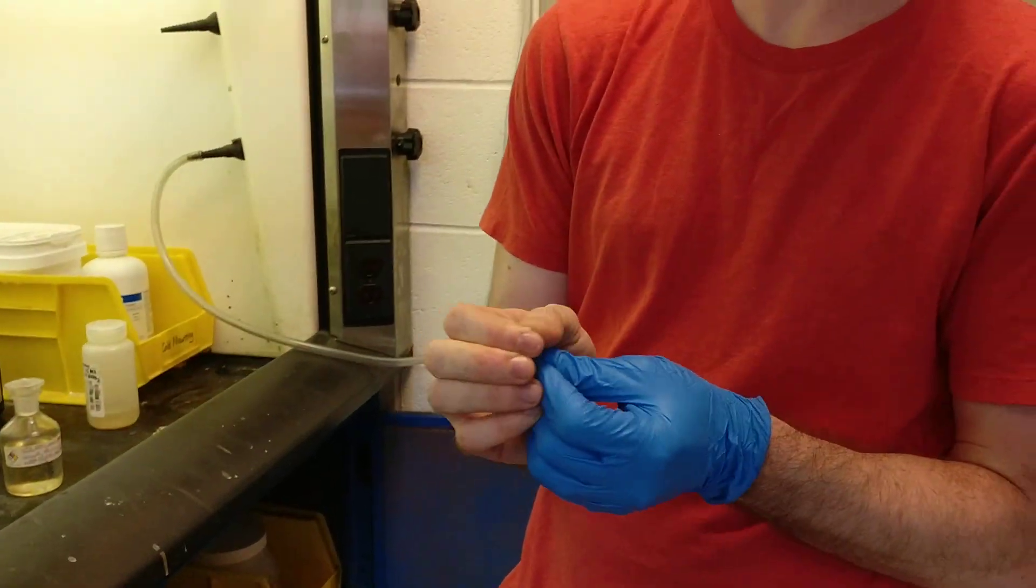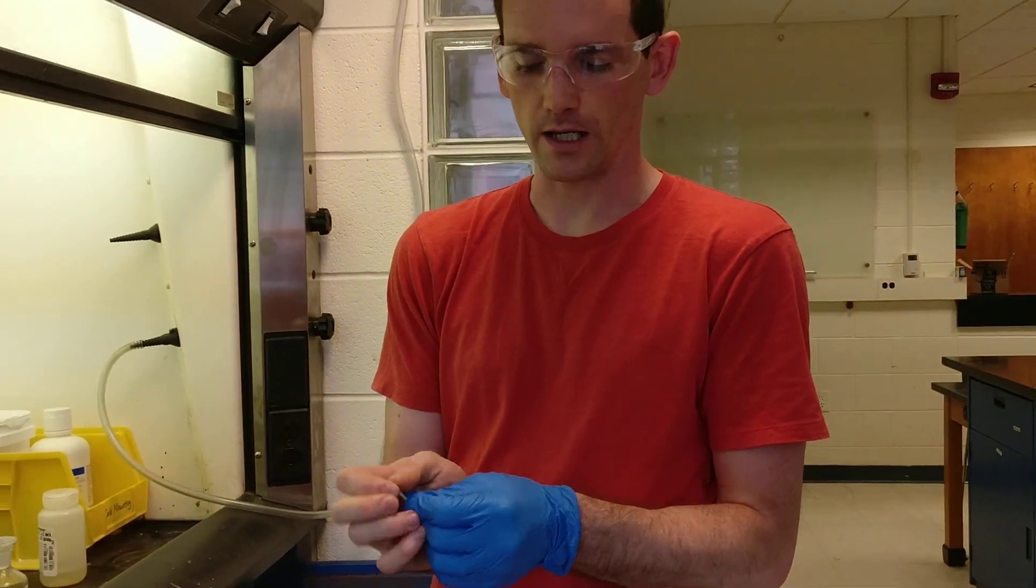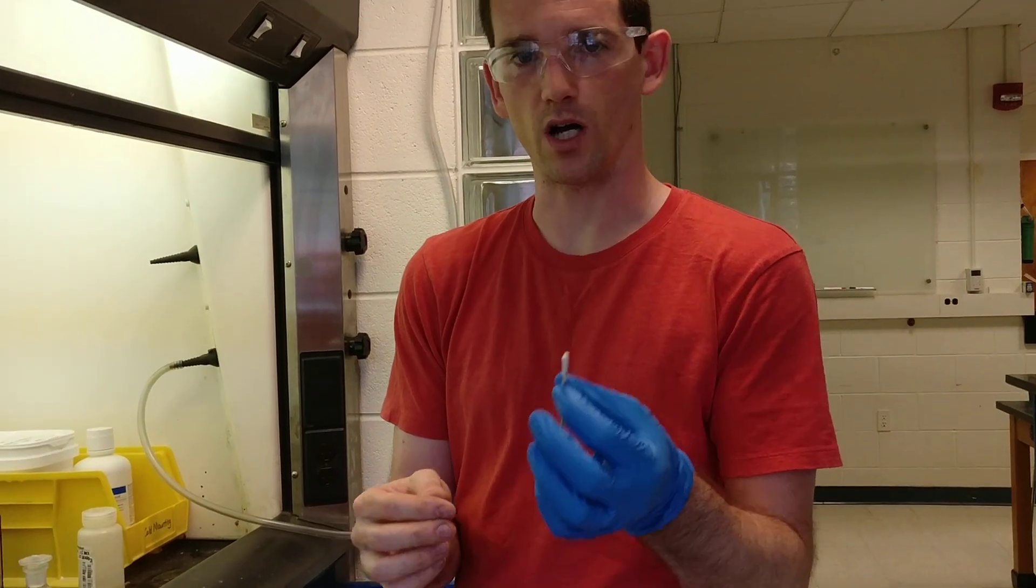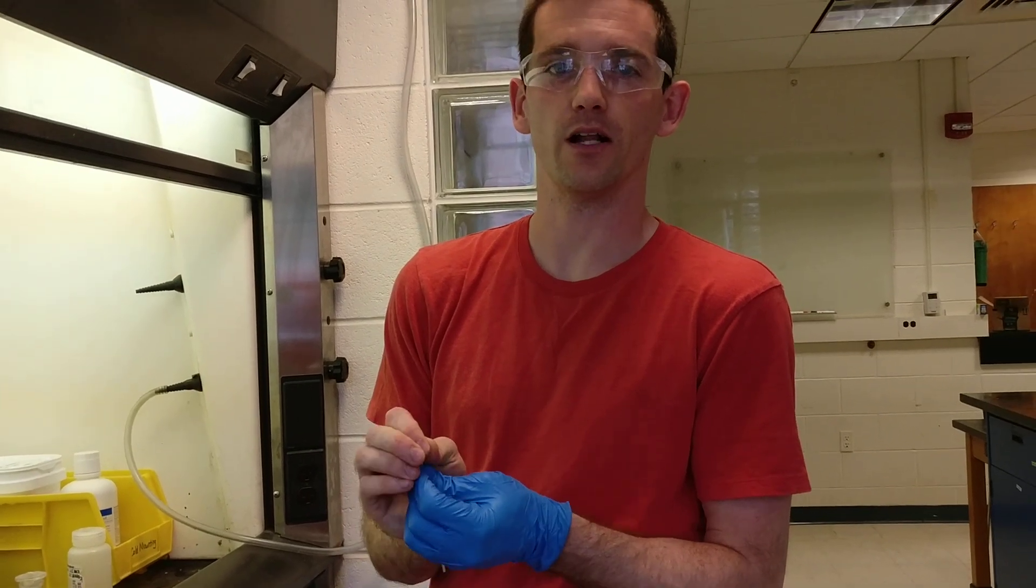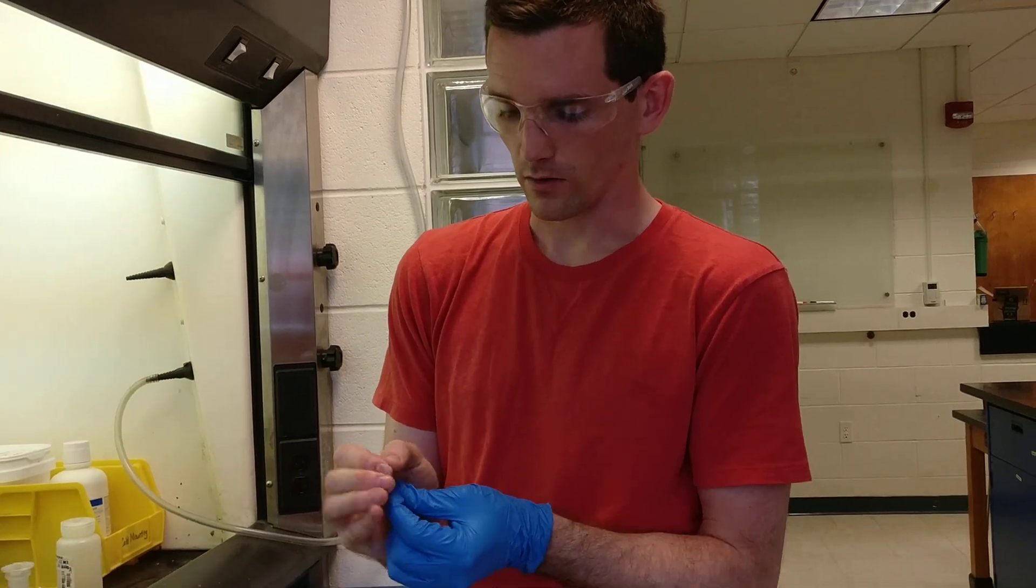One of the most important things when we etch is that we get a lot of the etch into the swab. We should swab etch on steel, aluminum alloys, titanium alloys, stainless steel, anything that will spontaneously form an oxide.